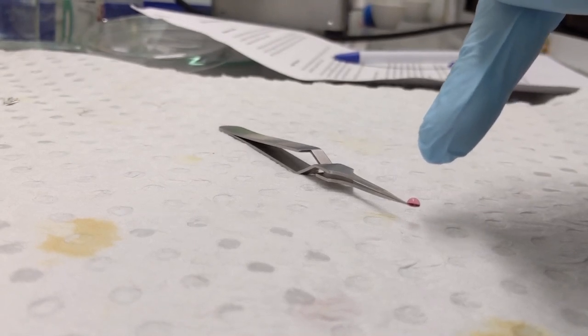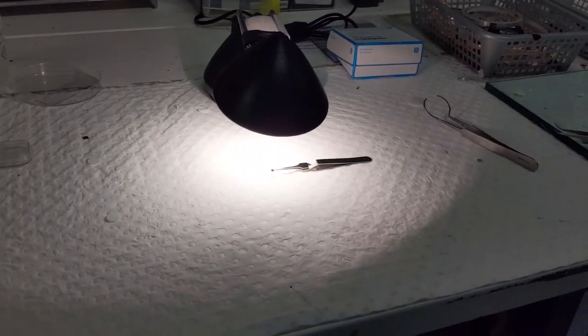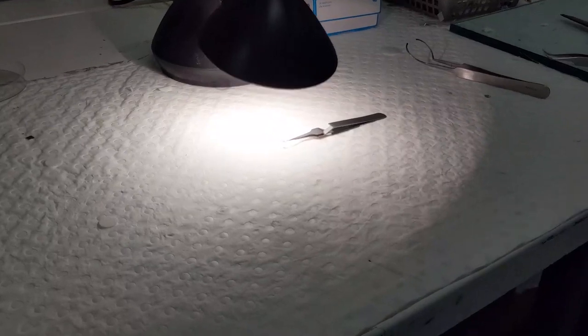This droplet will take approximately an hour to evaporate. Here is the sample under the light — we are just trying to speed up the process of evaporation. Okay, so one hour has passed, and as we can see, the sample which did have a droplet on it is now completely dry.